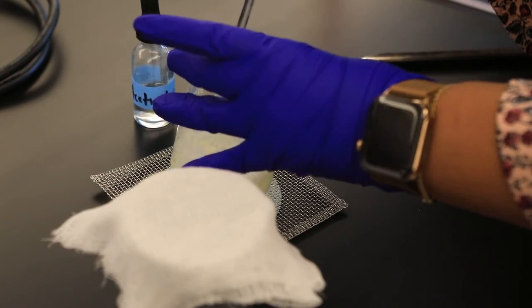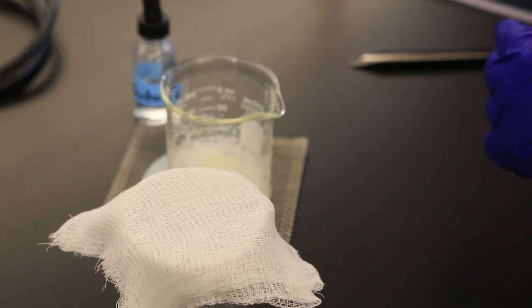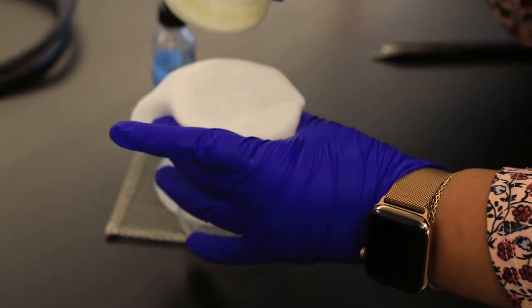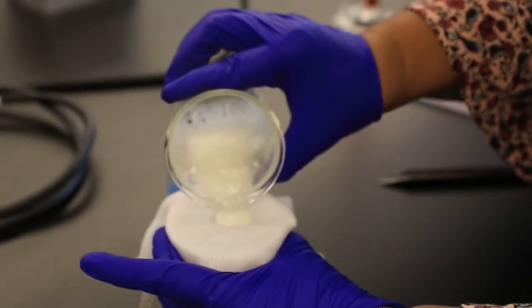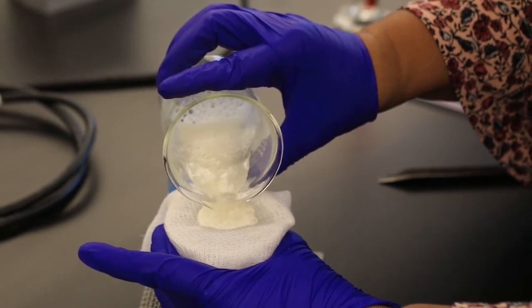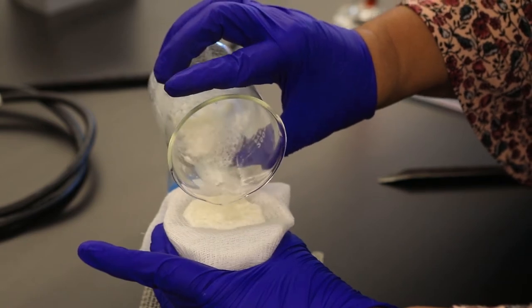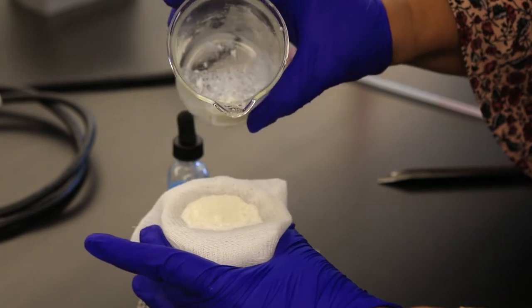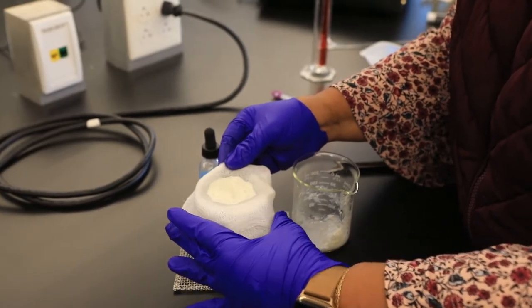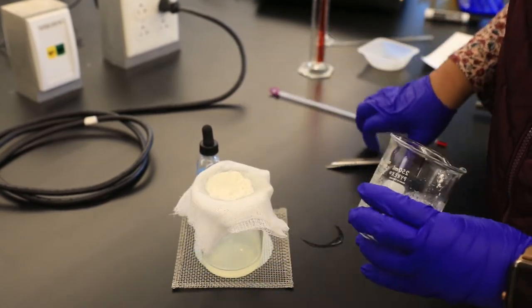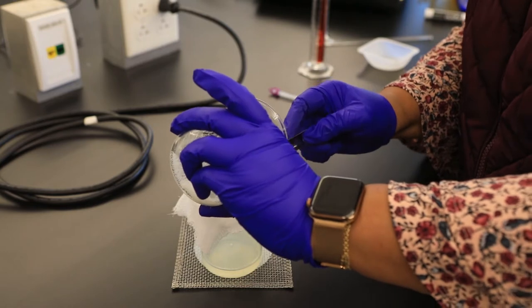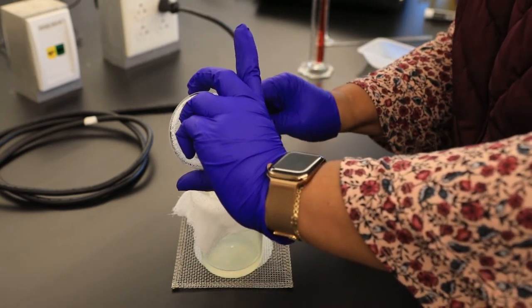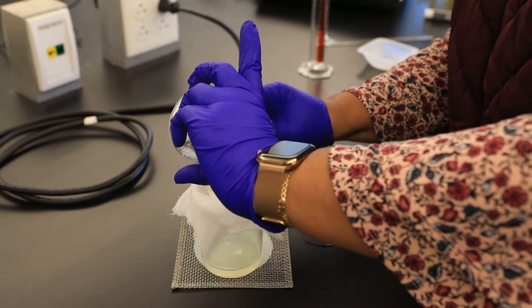The challenge now is to make sure that I collect this white precipitate. Slowly, I'm going to transfer the solid to the cheesecloth. Sometimes you might want to double up if your particles are too small. You'll notice that the casein is on the cheesecloth - I'm still used to filter paper, forgive me - and the solution has passed through.